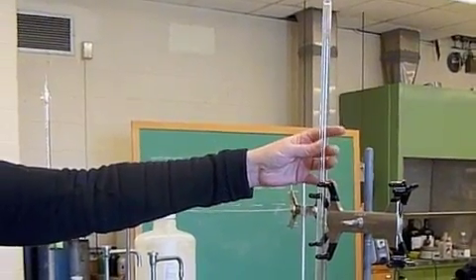Today we're going to prepare a sodium thiosulfate solution and then standardize it. Basically two parts: the first part, step one, we're going to prepare it. The second part, we're going to use this titration device and standardize it.